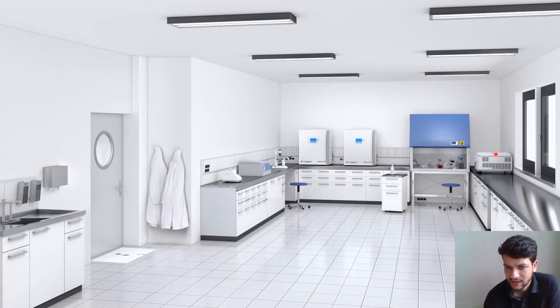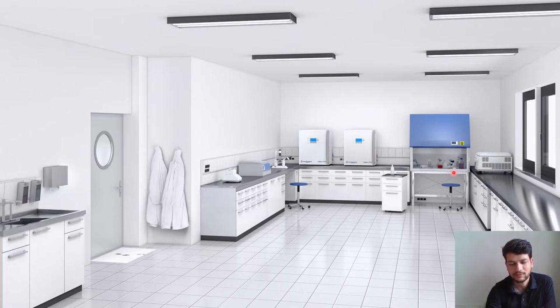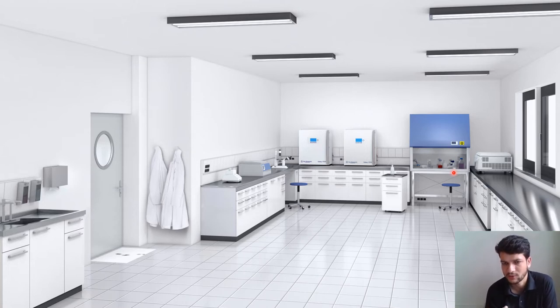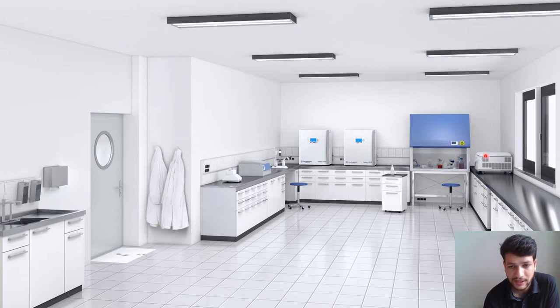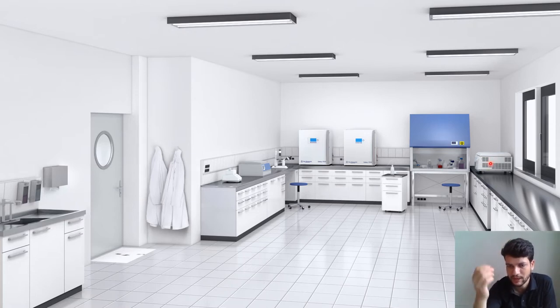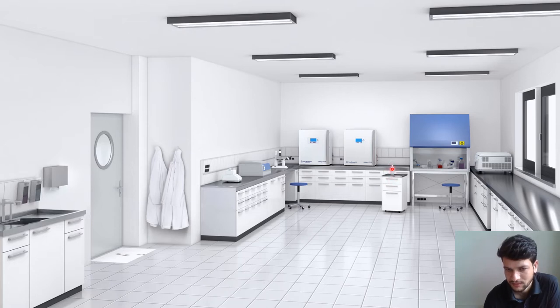This instrument is the centrifuge. When you have cells in suspension, or when you have removed adherent cells from the flask and want to isolate, count, or transfer them, or separate the media from the cells, you need centrifugation. When you centrifuge the cells they settle down and you can remove the media.